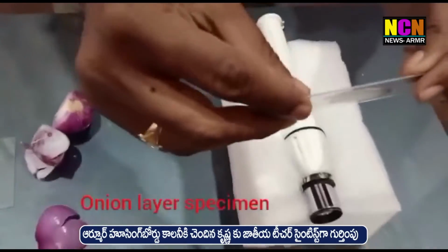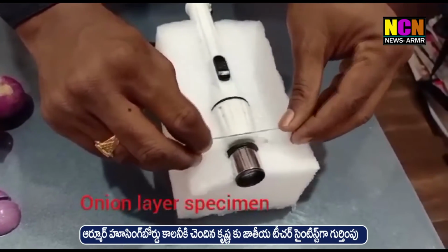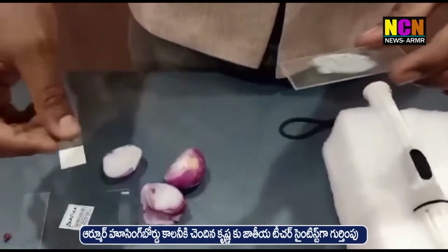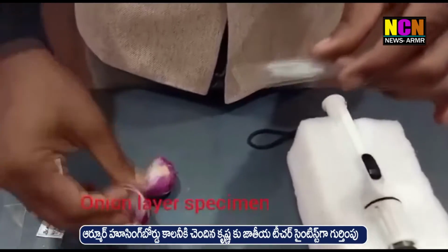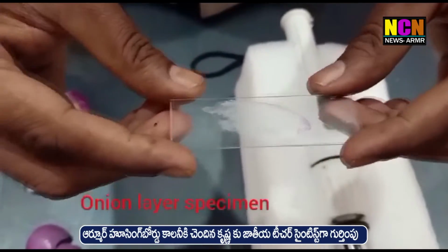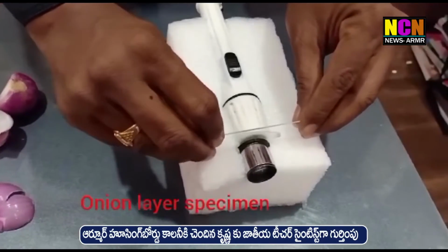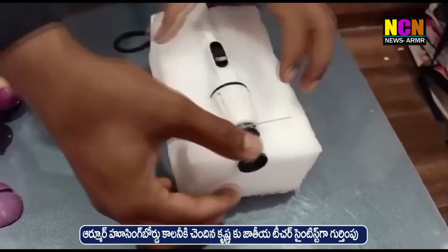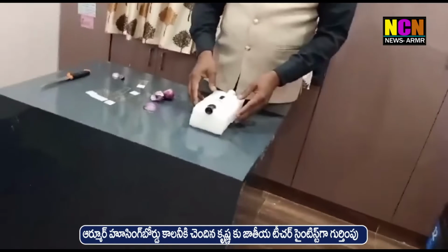After placing it, we have to set it in between this torchlight and the eyepiece of the microscope, and we have to switch off our room lights.